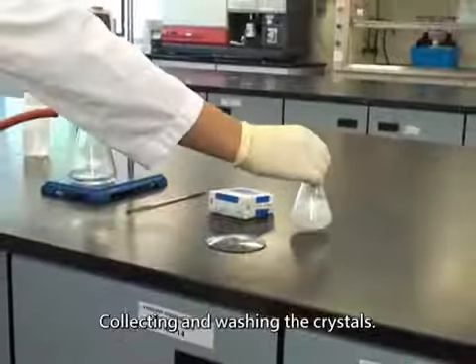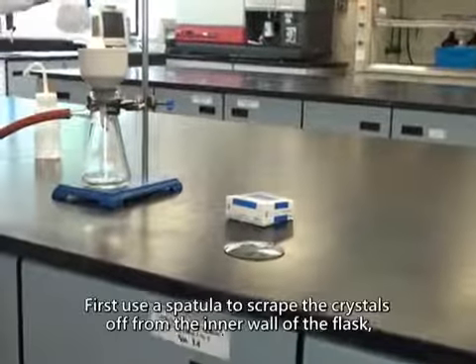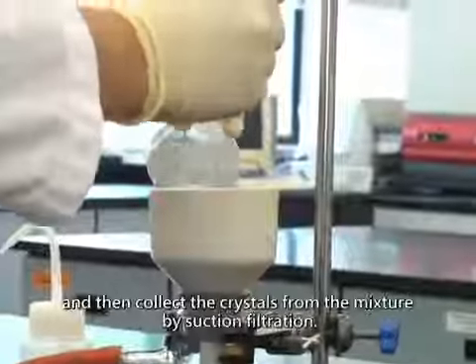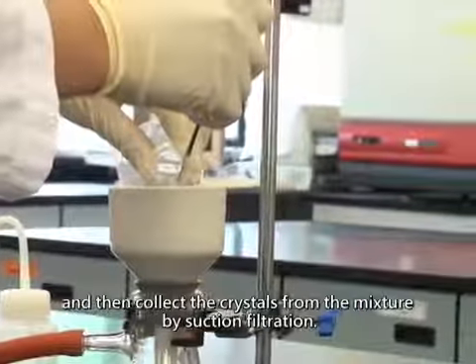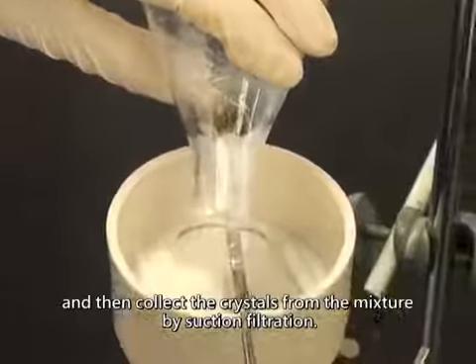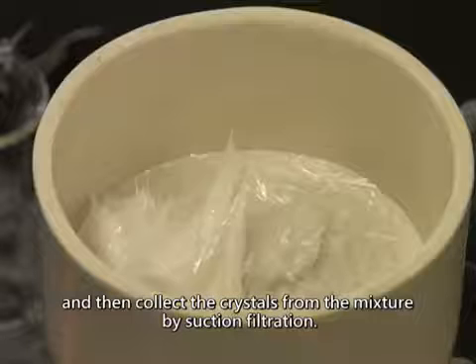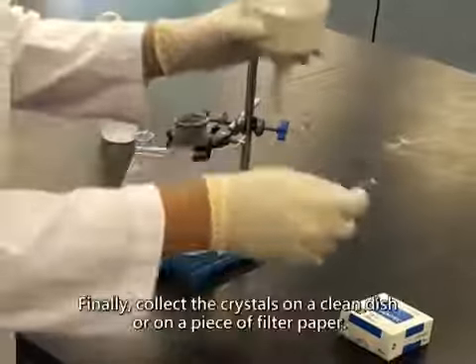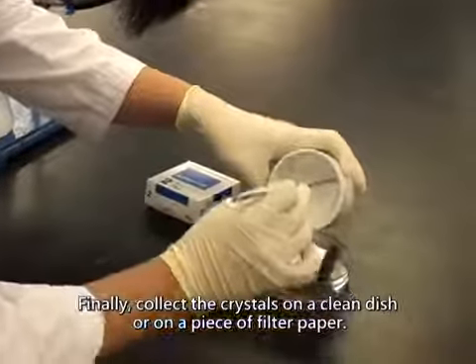Collecting and washing the crystals. First, use a spatula to scrape the crystals off from the inner wall of the flask, and then collect the crystals from the mixture by suction filtration. Finally, collect the crystals on a clean dish or on a piece of filter paper.